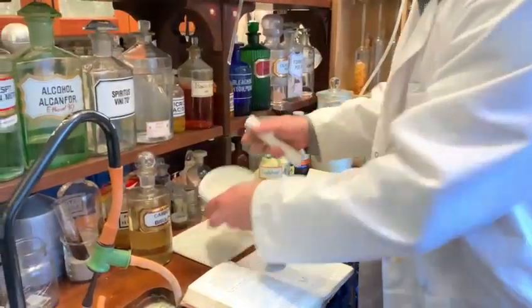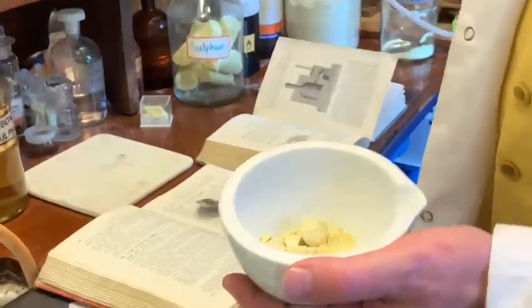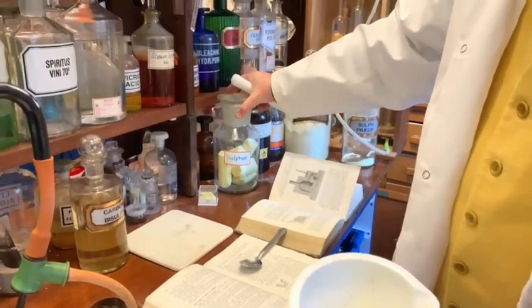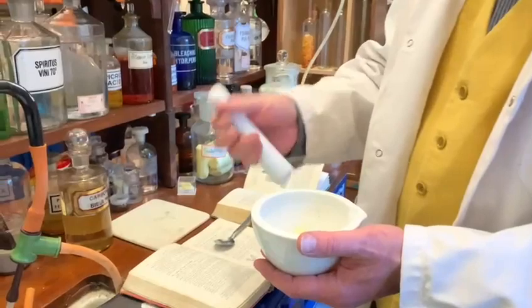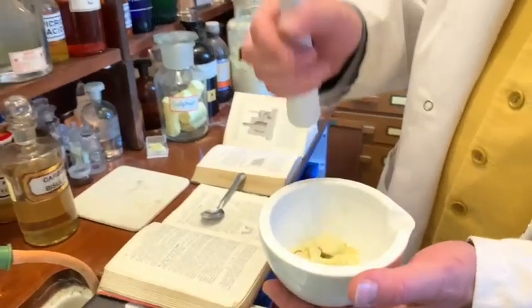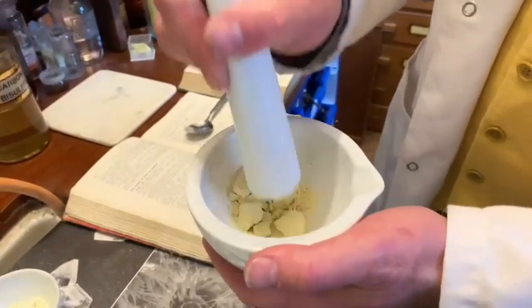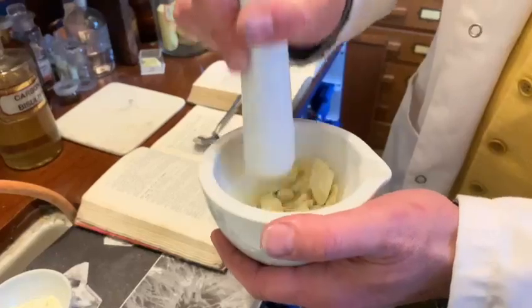Now I've got before me some roll sulfur. This is sulfur that has been extracted from the ground using the Frasch process, where hot water is pumped down at about 180 degrees, brought up, and then cast into molds. We're going to crush some of this — you can see it's a very brittle solid — and then see what happens when we heat it up.